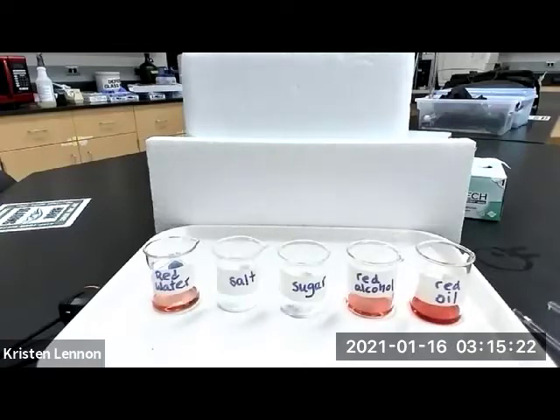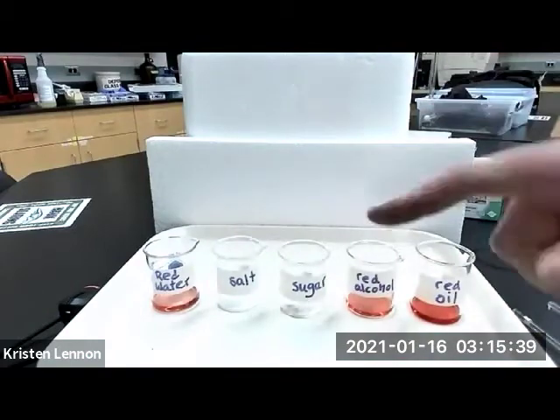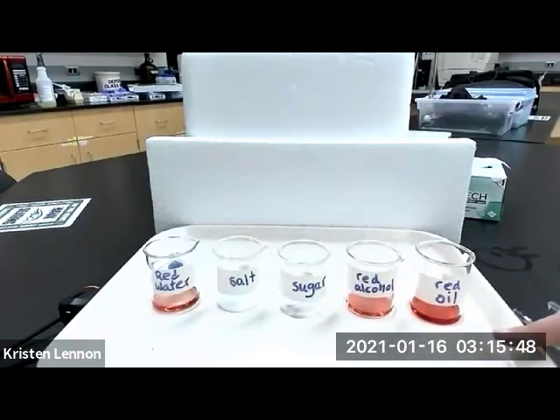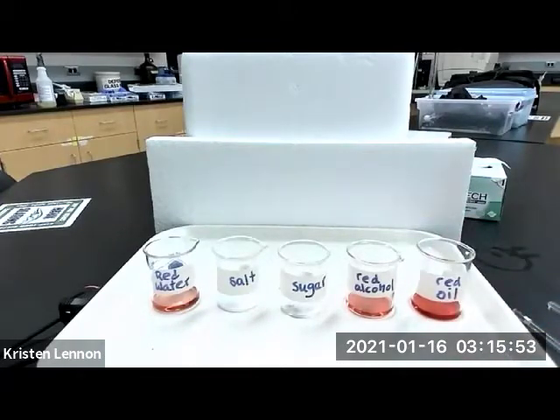I have set up for you 1, 2, 3, 4, 5 very small beakers, and this may vary a little bit different from what you see in your lab handout, but I'm stuck with what I have available at the moment. In these little beakers, I have put about a teaspoon of red water, about a half teaspoon of salt, sugar, about a teaspoon of red alcohol, red ethanol, and about a teaspoon of red oil, or mineral oil. And you'll see these in your lab handout.